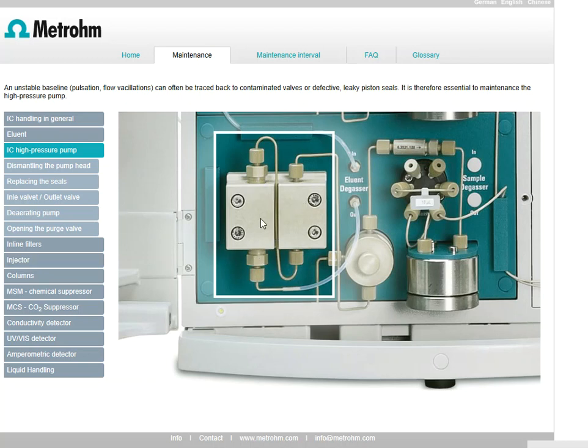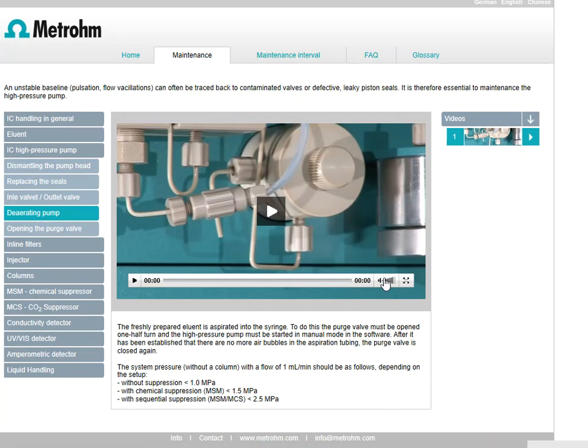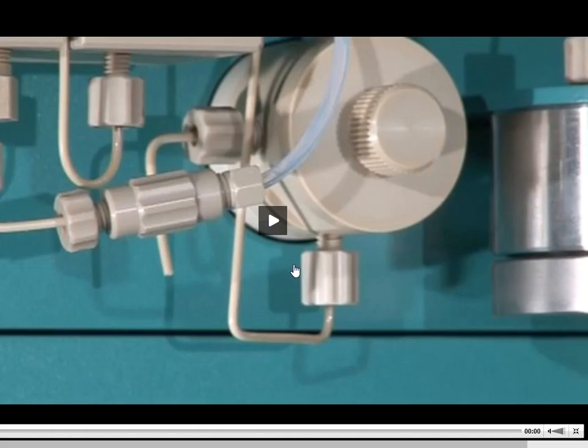So when I put all of this back together, screw this back on, screw those valves back on, and then put my pump back in the holder and screw those back in, I have introduced a huge air bubble on the inside. And we do not like air bubbles. We do not want our air bubbles to go to the column. So that is the purpose of de-aerating the pump. We call this purge. We are purging the pump.